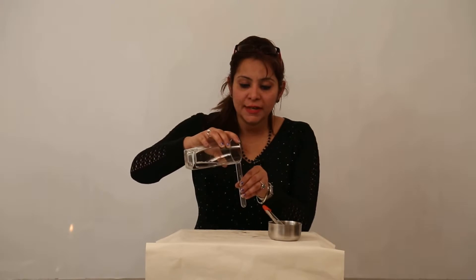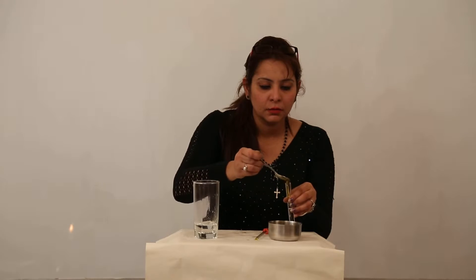We are using a technique to separate two immiscible liquids. I've taken a test tube with water and I'm adding oil to it. This shows the basic principle of the separating funnel. I'm making a mixture of the two immiscible liquids and mixing them by shaking the test tube.